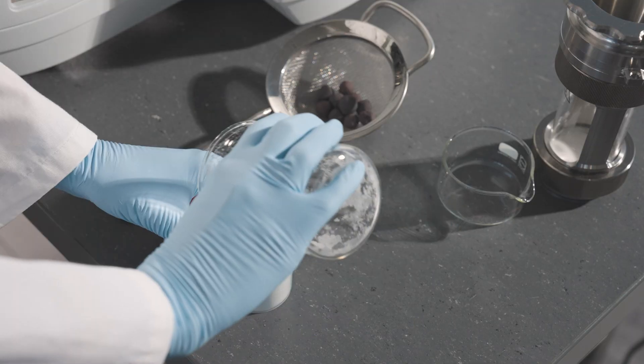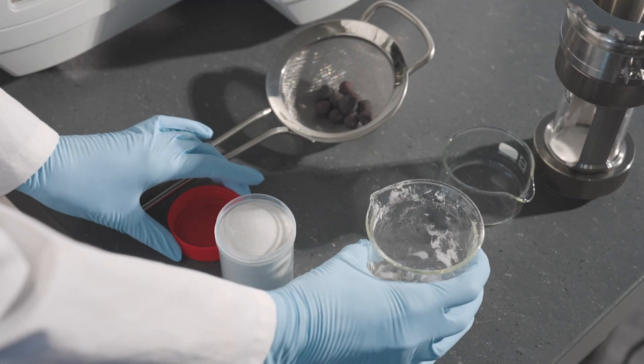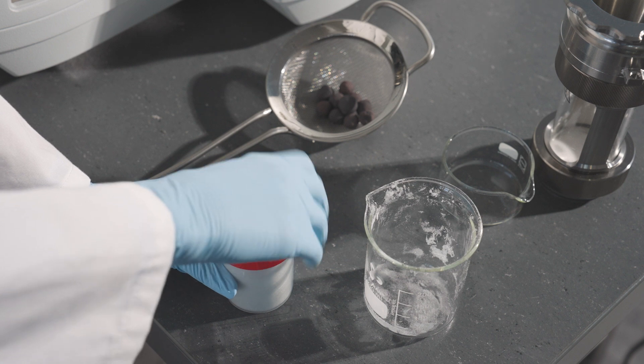The displacement powder can be reused. Check the powder for impurities before reusing it.